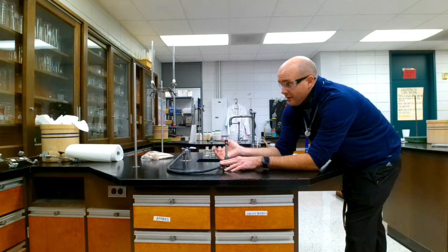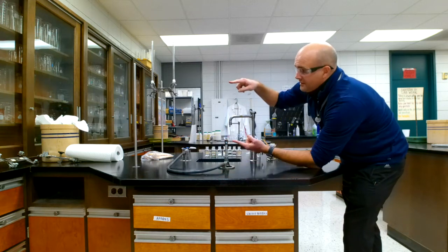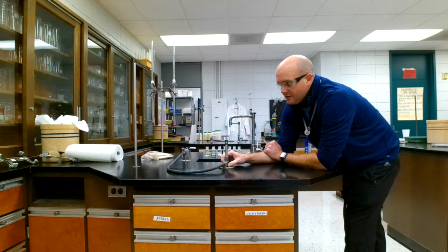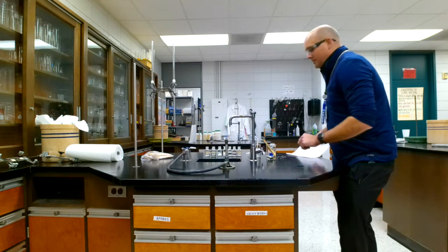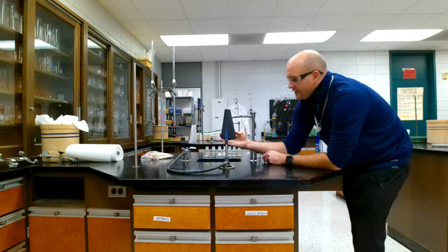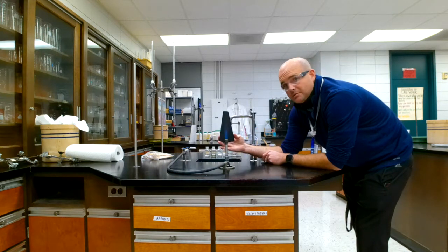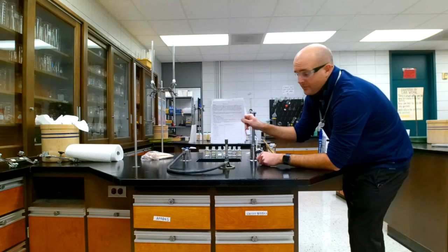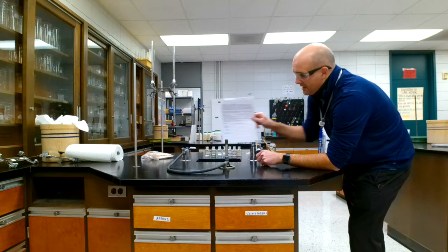So you'll see that the flame turned blue, but it's this tall. So that's not good. We want to lower it, and so we'll decrease the amount of gas. You see I'm changing this part right here. Now I'm going to fiddle with it to try to get the double blue cone. And as you can see, maybe on a black background, you might be able to see the double blue cone, or on a white background maybe. I know you're supposed to have them a foot away, but hopefully you can see maybe that.